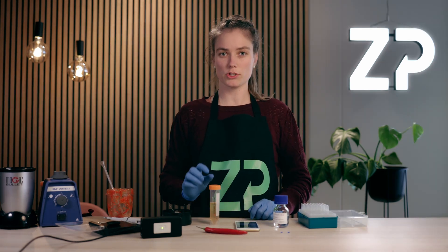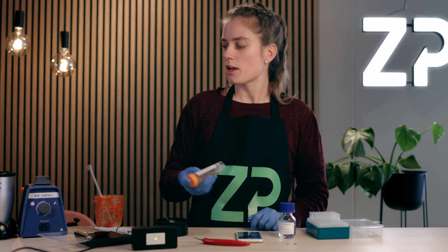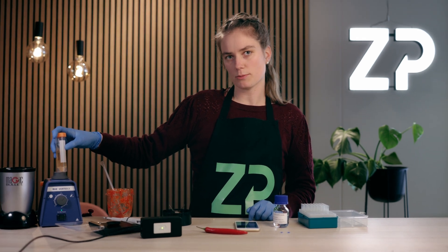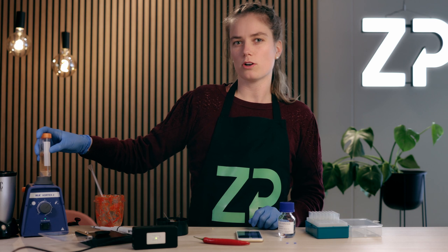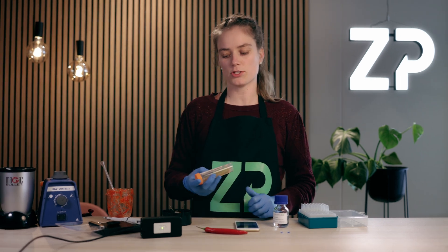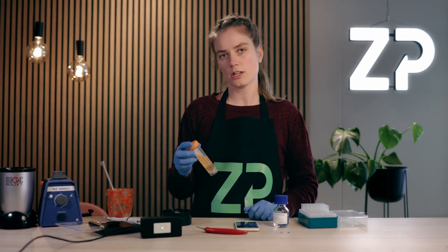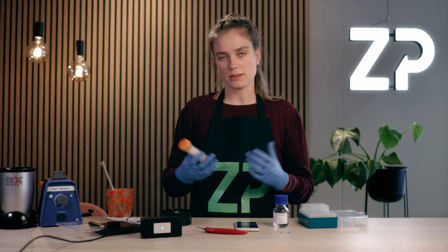In order to extract the capsaicin from the chilies into the buffer, we'll use a vortex to mix it well and get as homogeneous a solution as possible. The more chunky your solution is, the more time it needs for extraction. So ideally for this much of a chunky solution, we would like it to rest on the bench for maybe an hour.